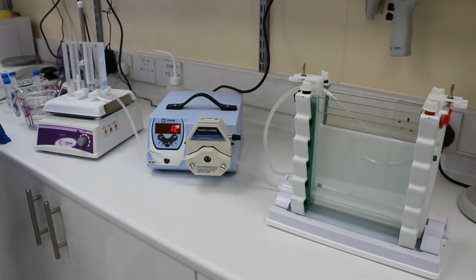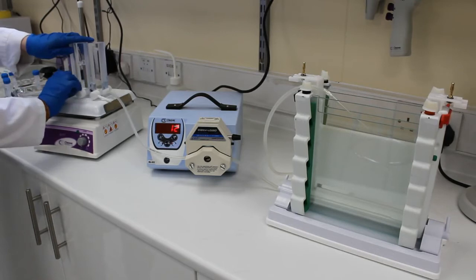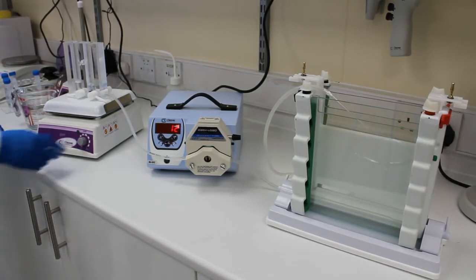It's dropped below now so now we're opening the second valve and now our lower denaturing solution is flowing into the first well and they're mixing together. So as the pump flows through we're getting a mixing of the two denaturing solutions and that will create the gradient.